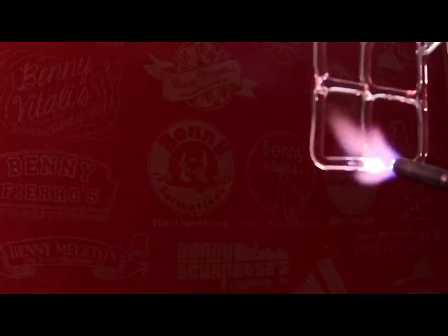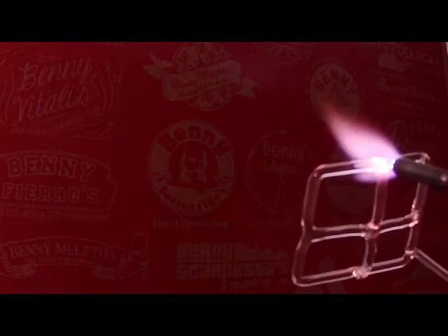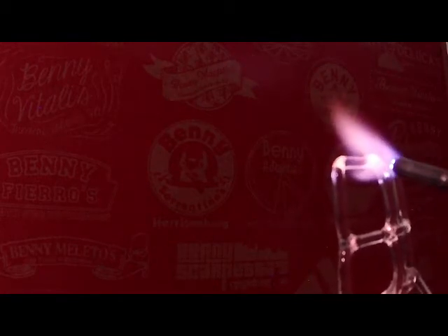But in case you were wondering, can't you just smush it right there? The answer is yes. But I'm afraid I would do more damage than good. And what I'm trying to do is come in here along these seams and get that all nice and hot so all of that glass is fused together.